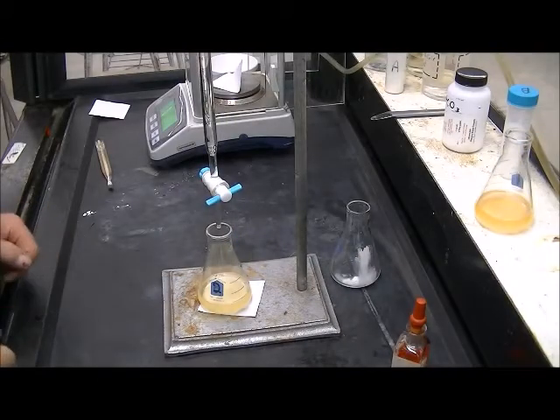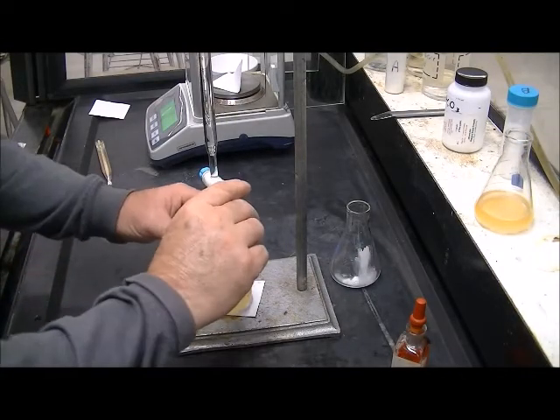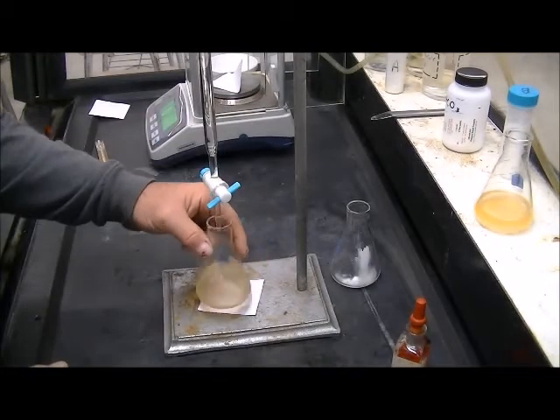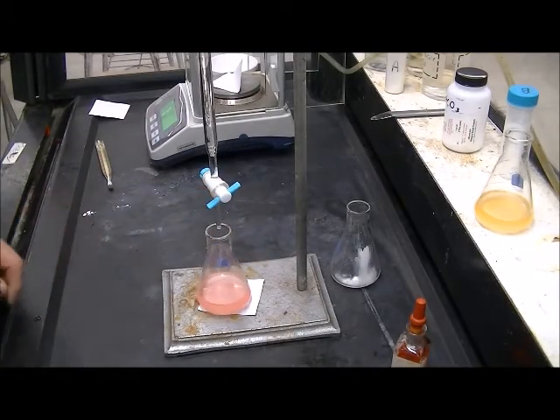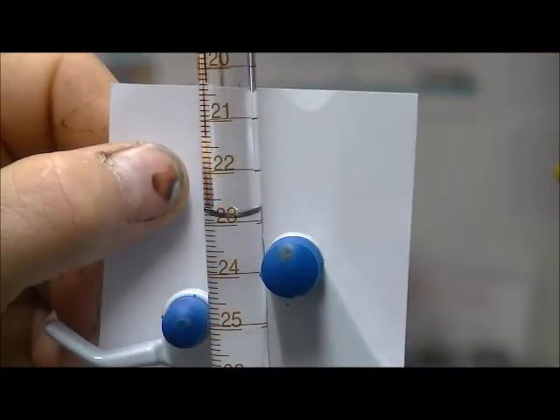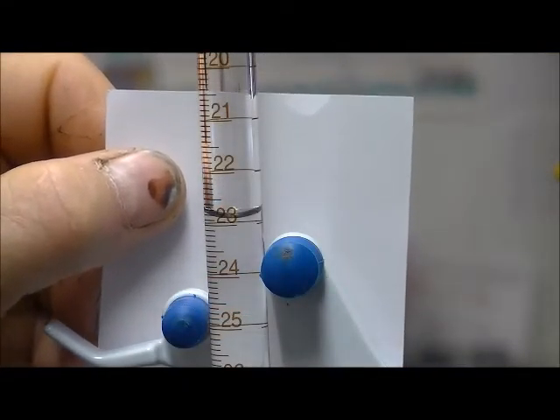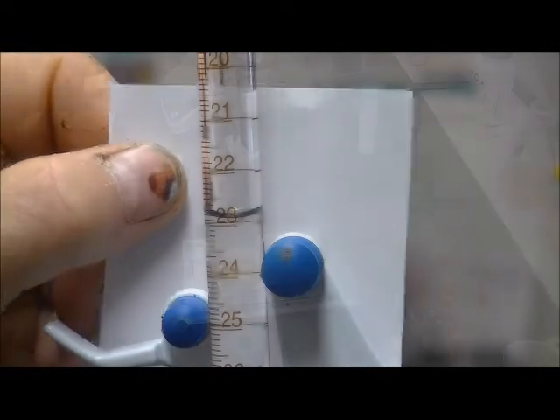Okay, this is the second sample of unknown B. And there we have it. 22.9 milliliters.